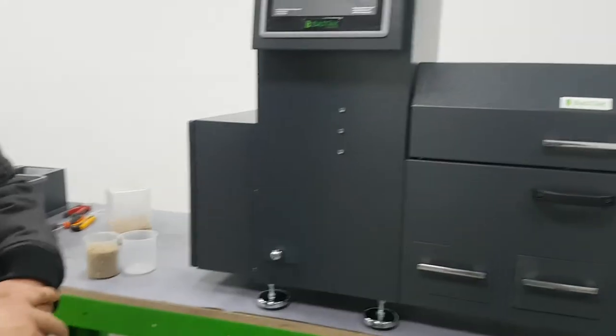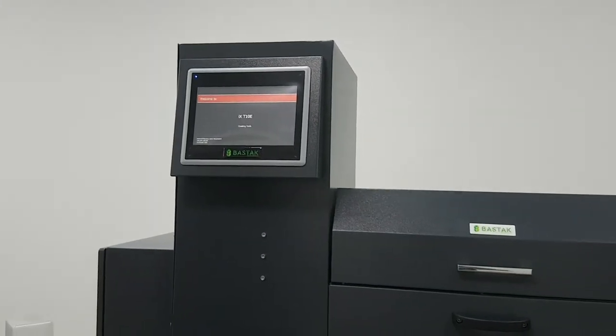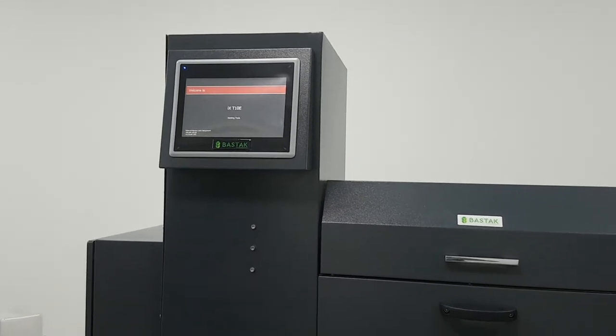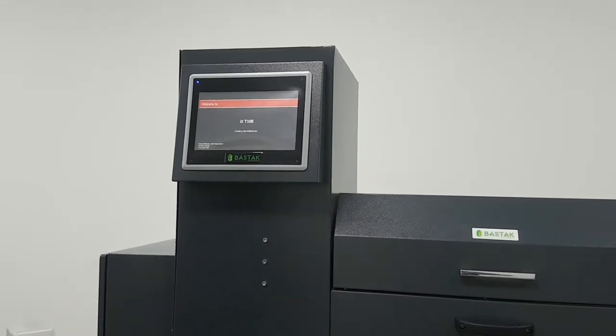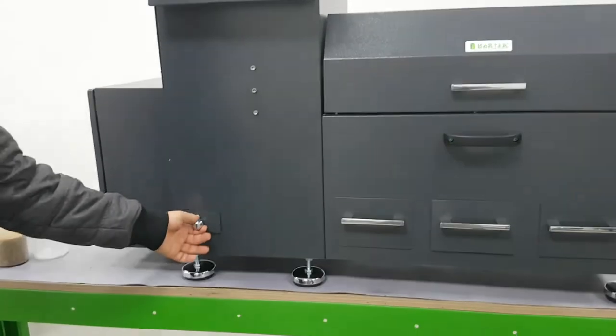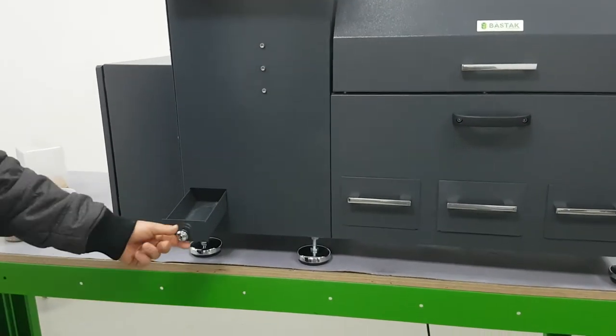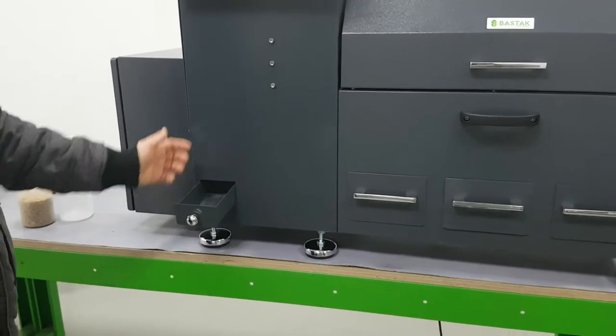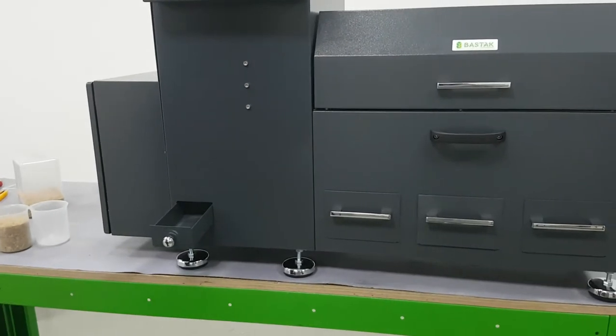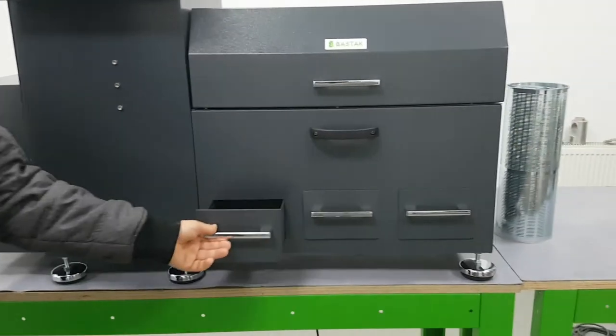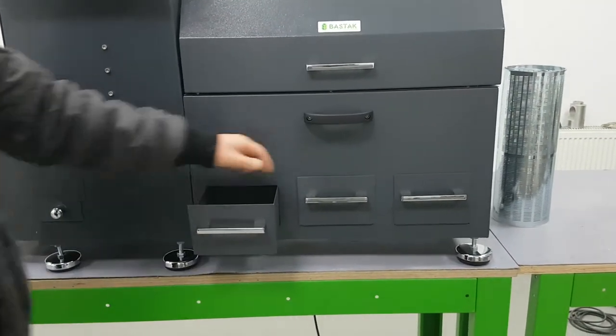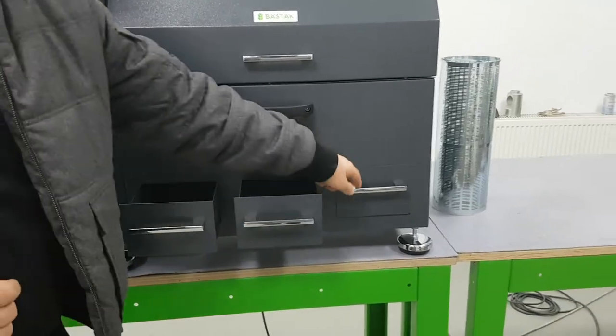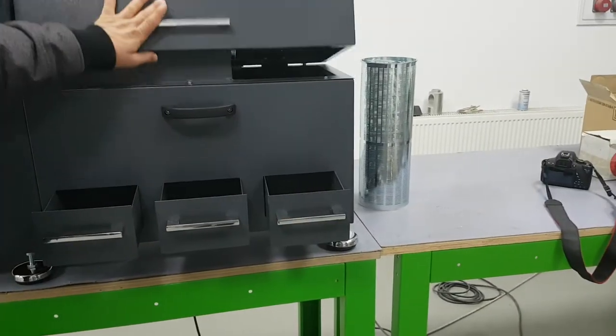The machine will start like this. First we have the light materials, which come here by air blowing. Second we have the broken materials, the wood materials and the foil materials.